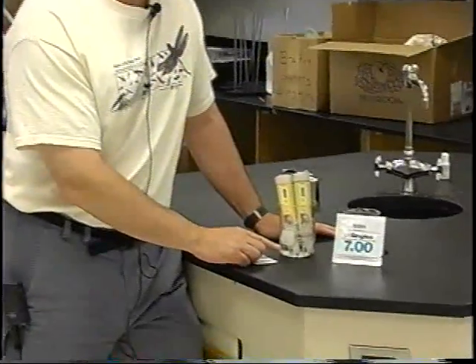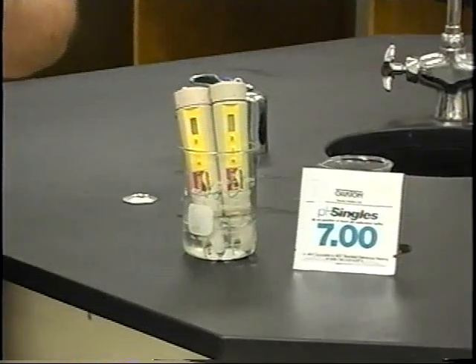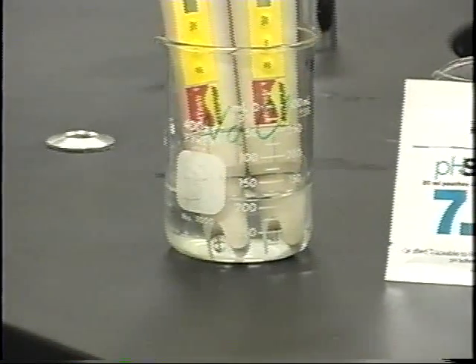Well, you have to condition the pH meter by putting it in tap water at least 24 hours before you go out to test it. You don't need to turn it on. You just need to make sure that the electrode is in the water. And that's what I've done. I've just put tap water. Do not use deionized water. And one of the things that you'll see is in your pH kit, there is a little manual that kind of explains things to you.